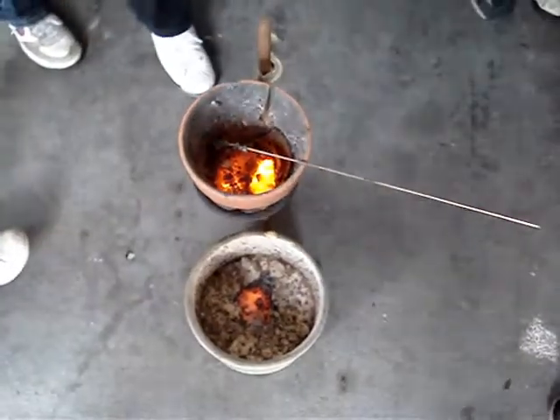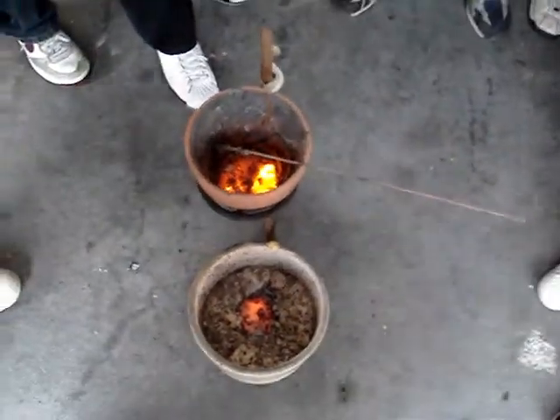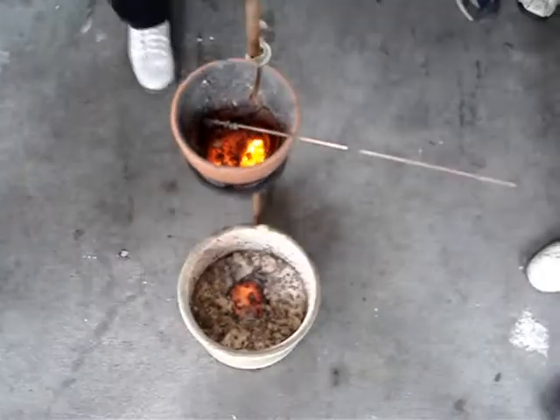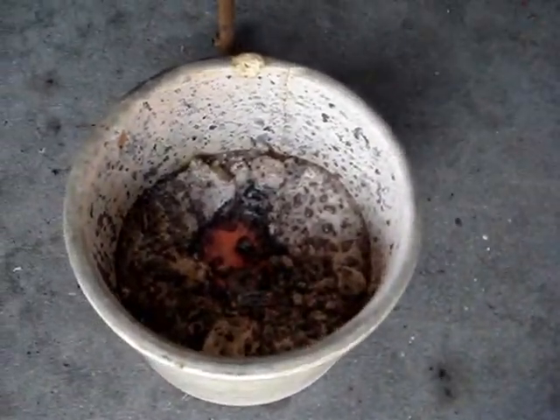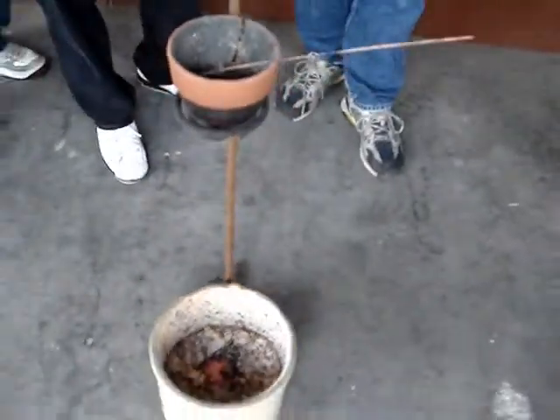It's going to smell like cabbage — it smells like cabbage. It's the cabbage lab. Now everybody go ahead and go on inside. We're going to let this cool for a second. I'm going to dispose of it, and I'll show you the molten iron.